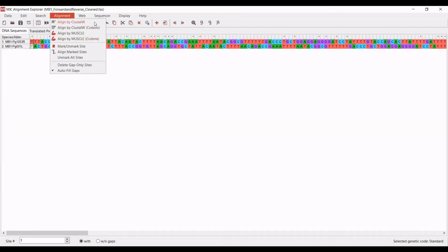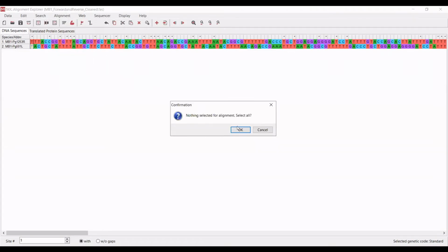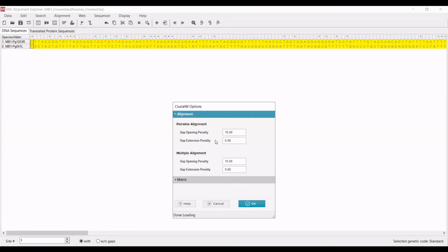So I personally, for statistical reasons, always align by Clustal W. But I'm sure that your advisor and your personal views have opinions about these. So do what you think is best for your research. Personally, I'm going to align by Clustal W. A little window pops up that says nothing selected for alignment. Select all. I will hit OK.